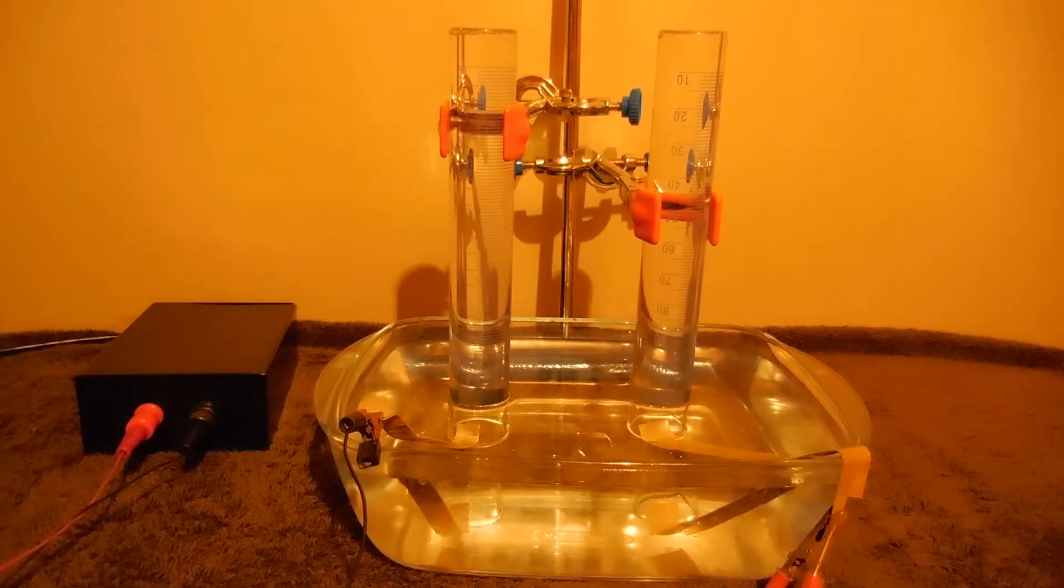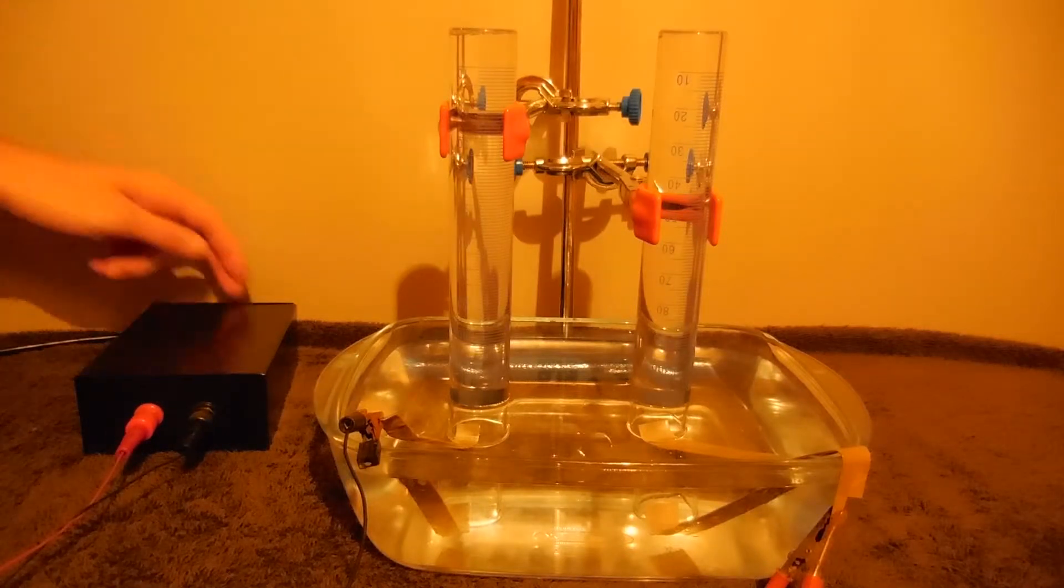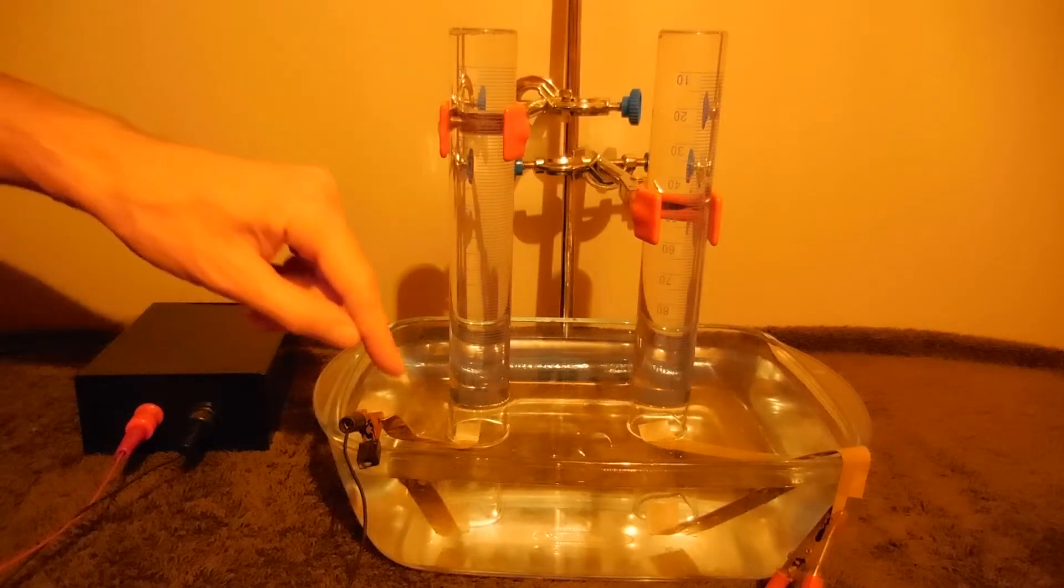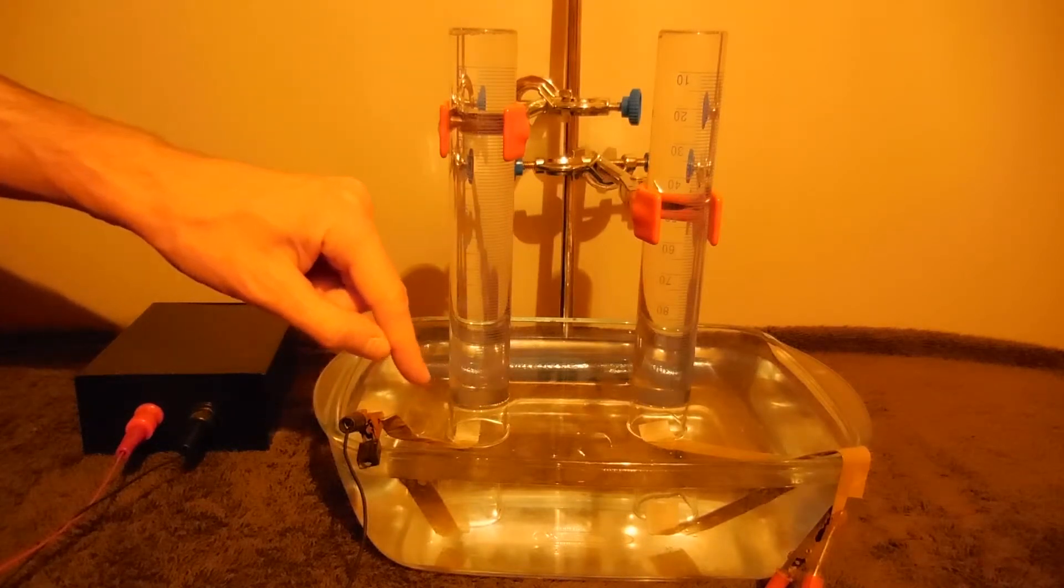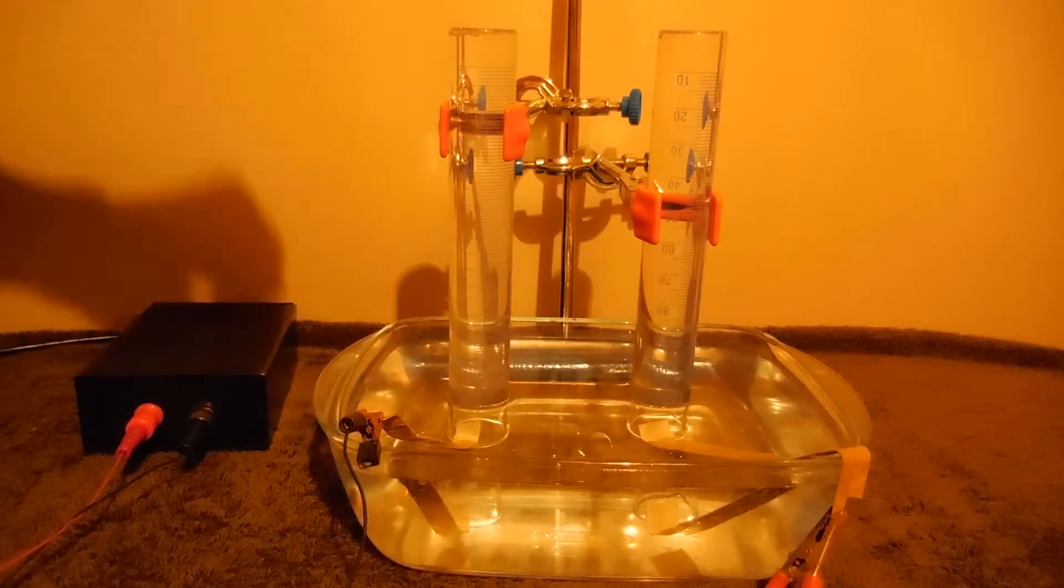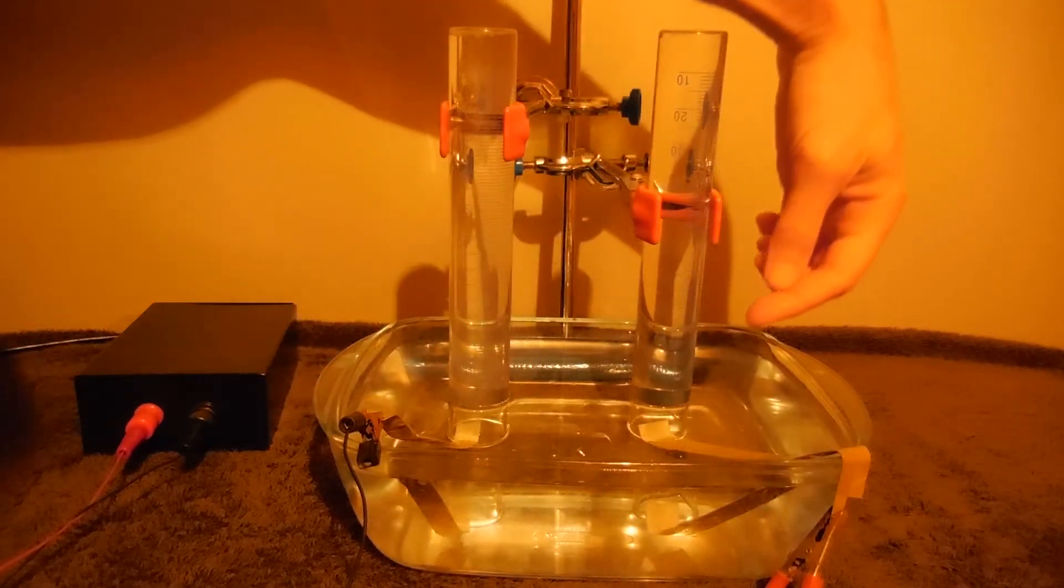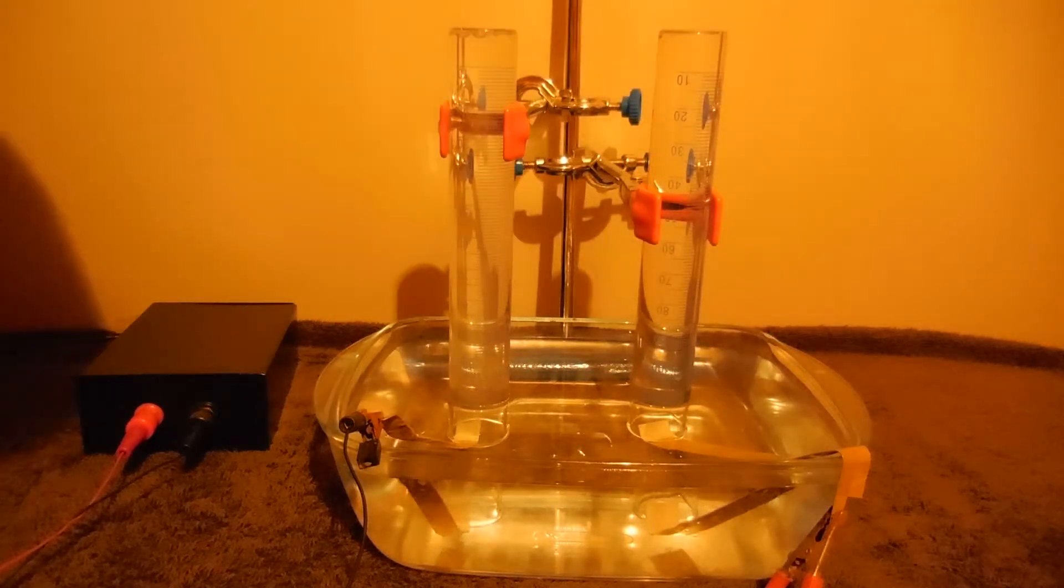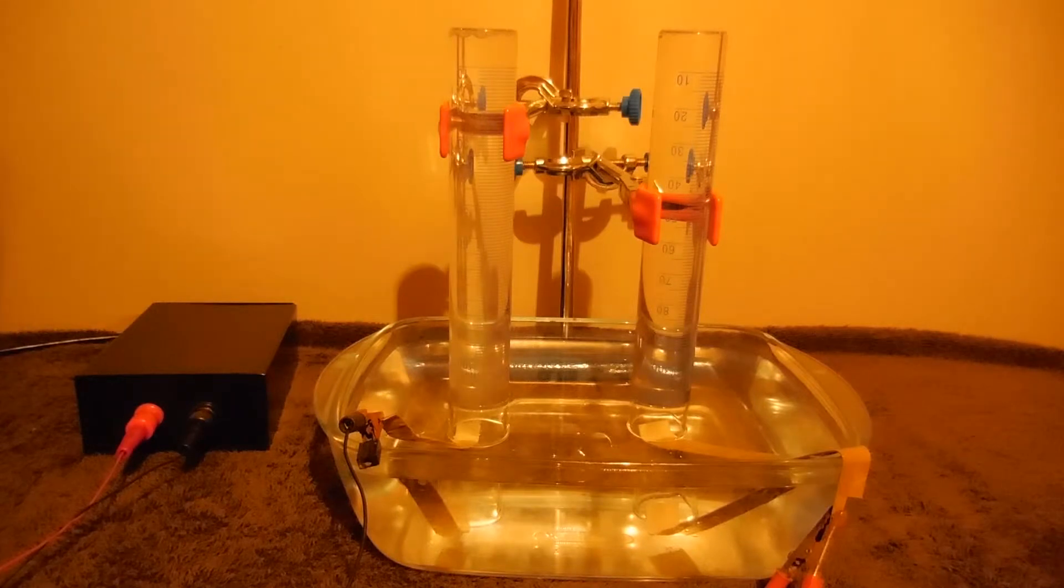Let's turn it on. We can see bubbles of hydrogen coming from the negative electrode and barely visible oxygen from the positive electrode. Both are aluminum in this case.